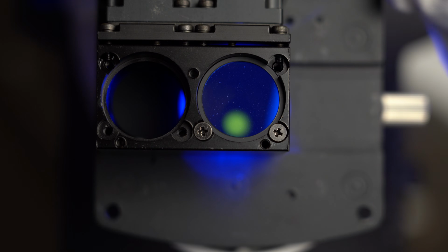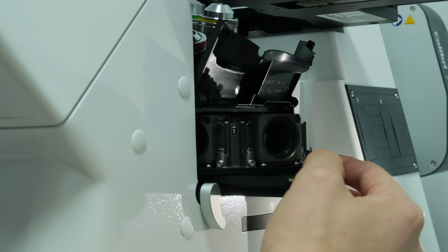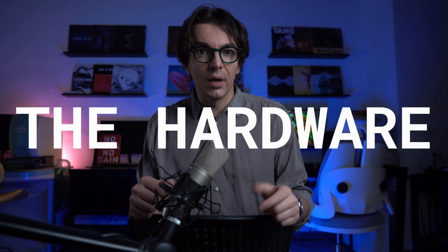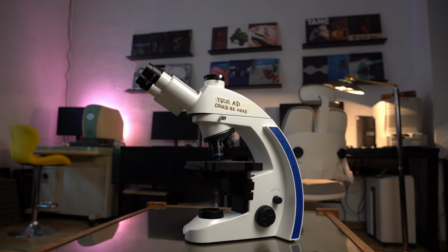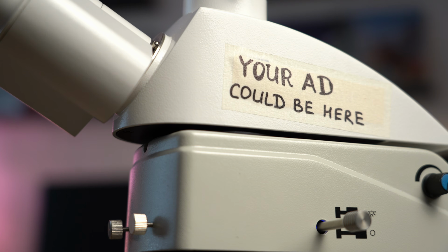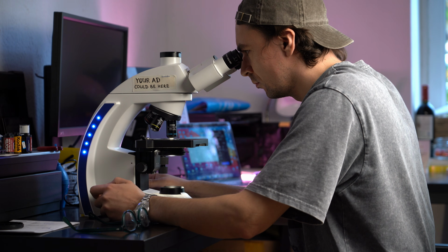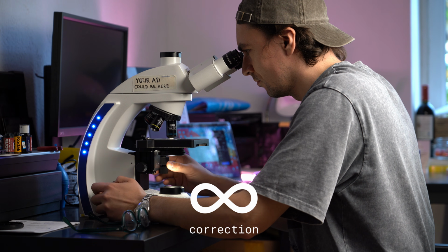Some microscopes have manual sliders, others use automated turrets with multiple cubes for different dyes or channels. Let's move a little closer to the hardware. In front of us is a standard transmitted light microscope, and we're about to install a third-party fluorescence illuminator on it. The objectives on this microscope are designed for infinity correction.